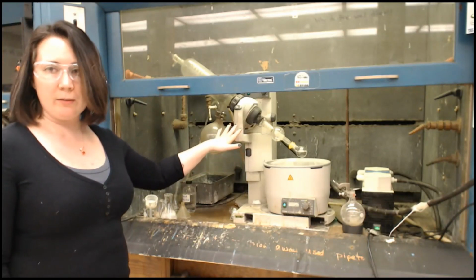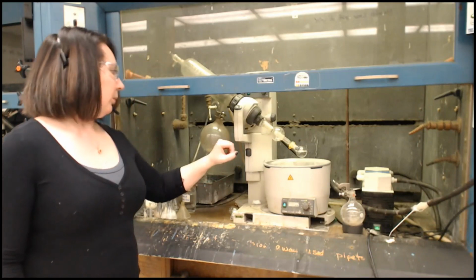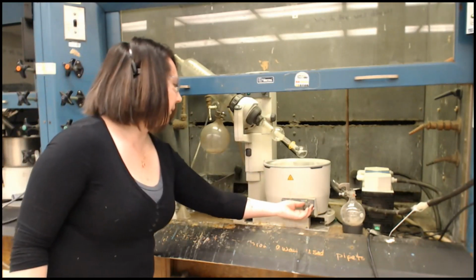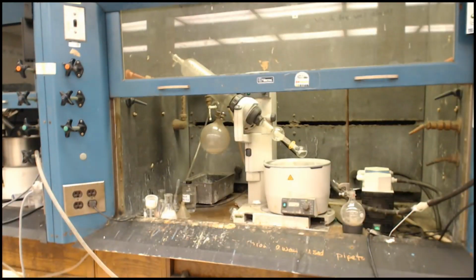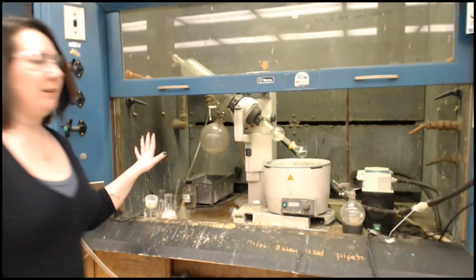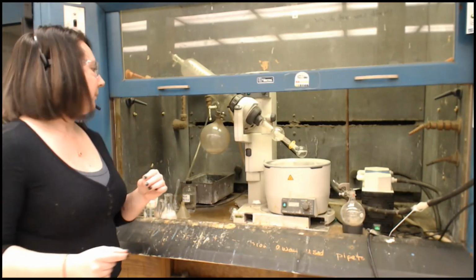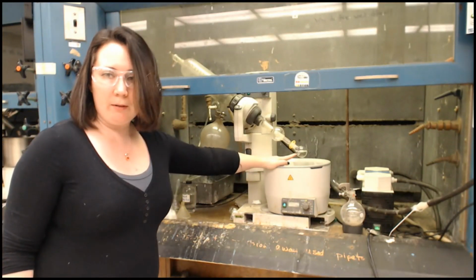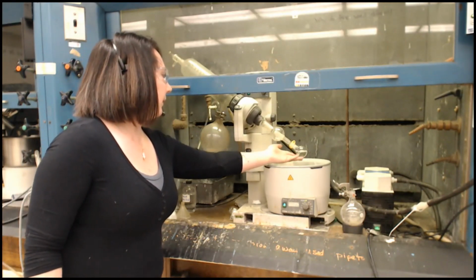That's going to decrease the pressure in the system. And what that means is it is going to start evaporating. I won't have to heat all the way up to like 78-ish degrees or whatever it is. Okay, sorry. Because these are all connected in a series, I had to go make sure that the other one was also closed so that it would work. But it is, so you can maybe see some bubbles. Maybe not, I don't know. But that means it's evaporating.